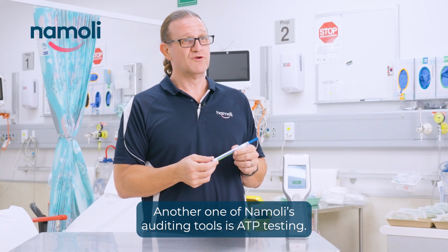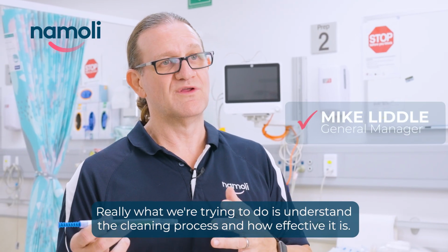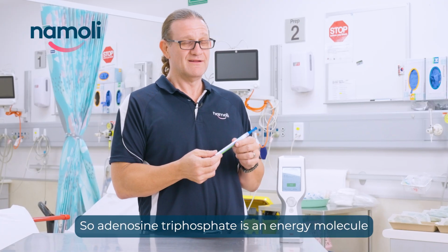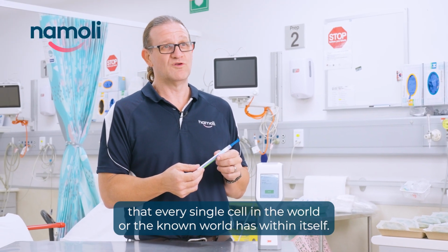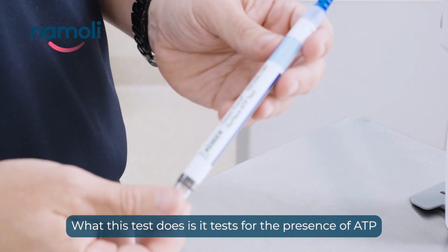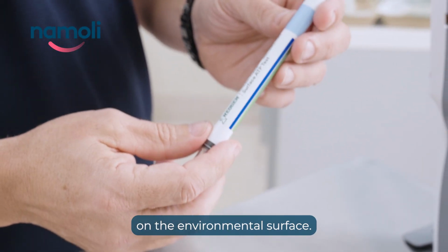Another one of Namoli's auditing tools is ATP testing. Really, what we're trying to do is understand the cleaning process and how effective it is. That's what this is really good for. So adenosine triphosphate is an energy molecule that every single cell in the world, or the known world, has within itself. What this test does is it tests for the presence of ATP on the environmental surface.